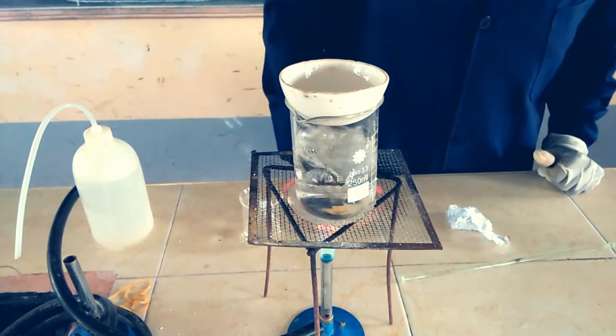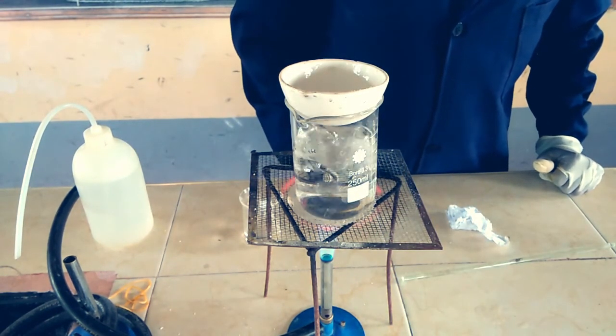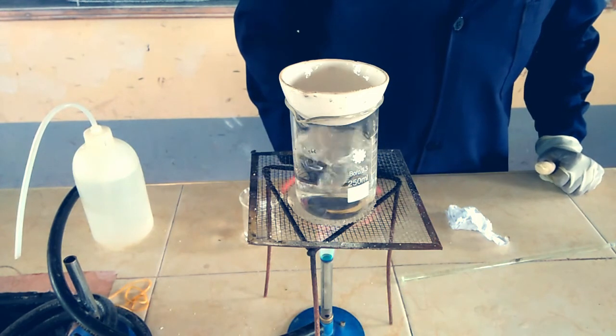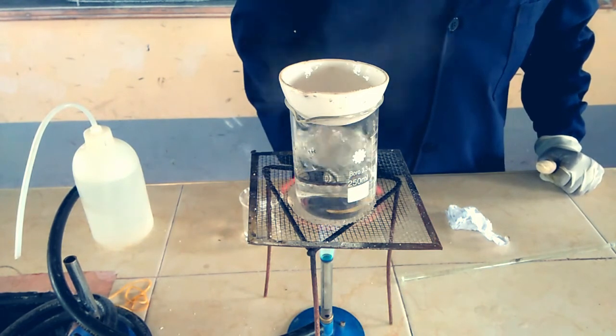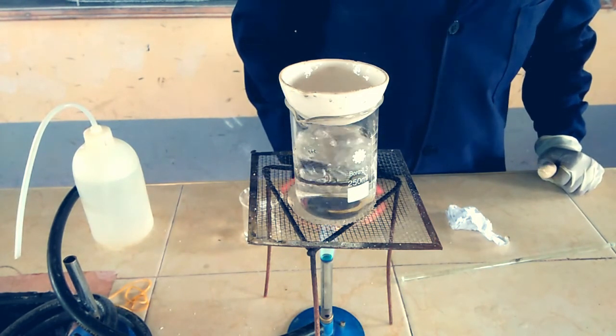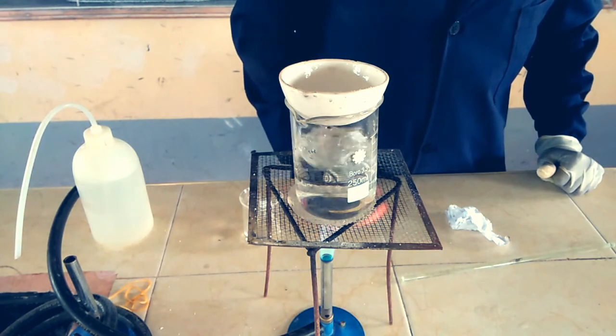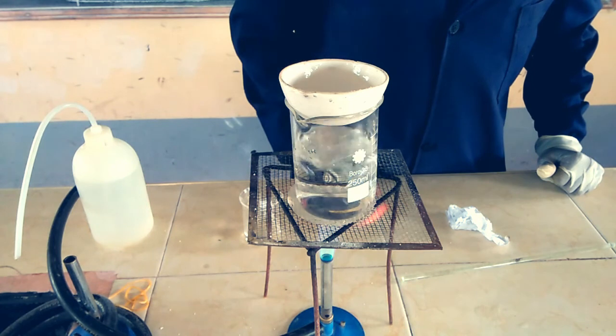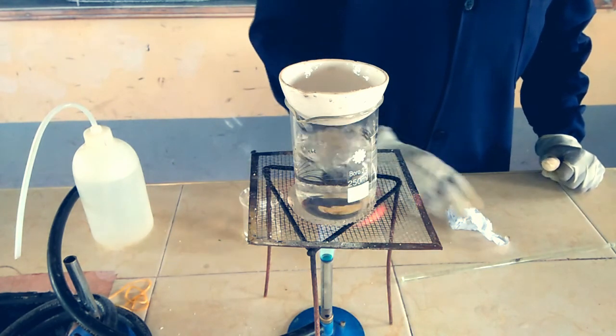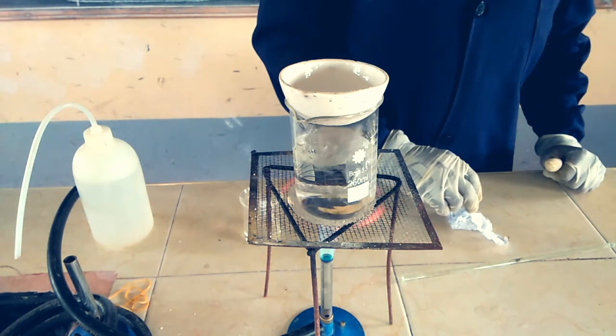I think we've already formed our solid. We have recovered our solid back. Let's just give it one minute. We've already recovered our salt. Let us see the result.